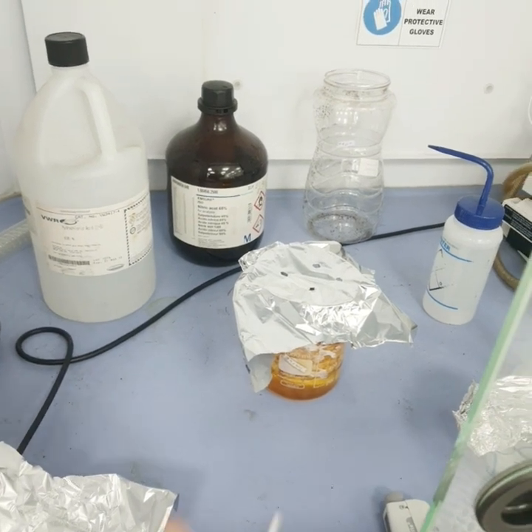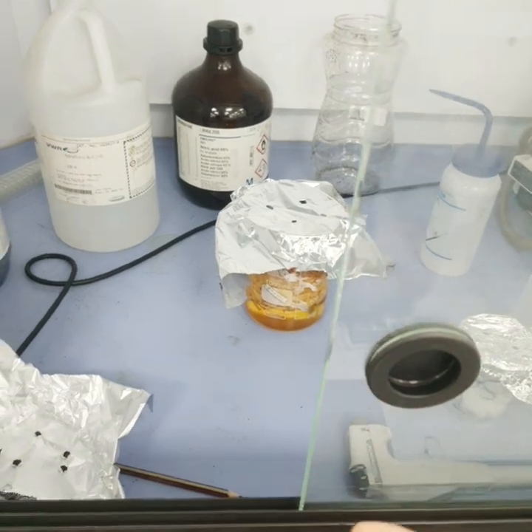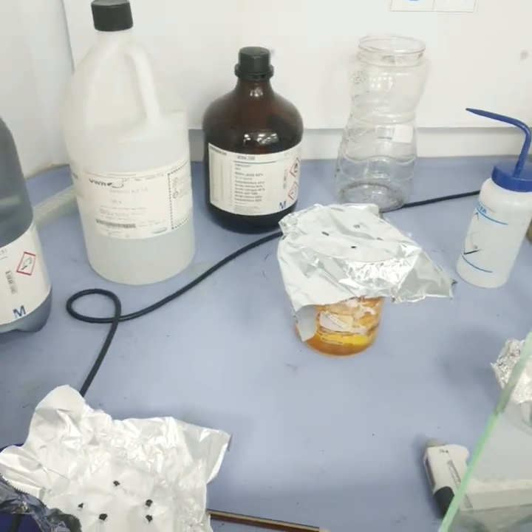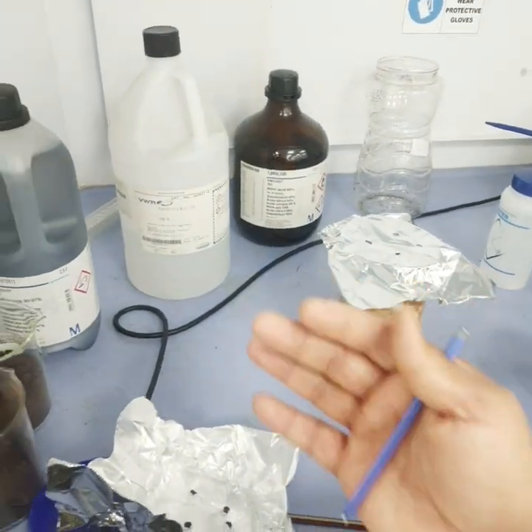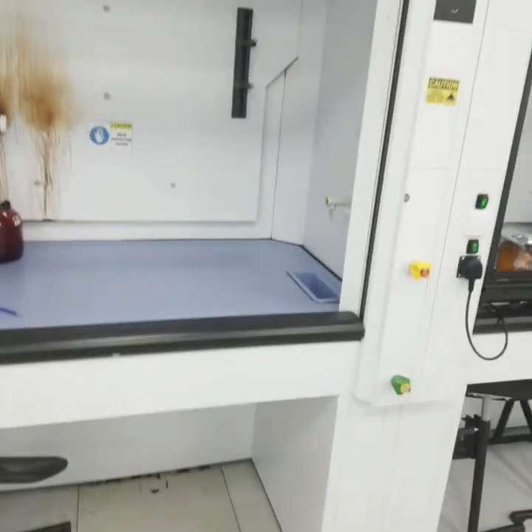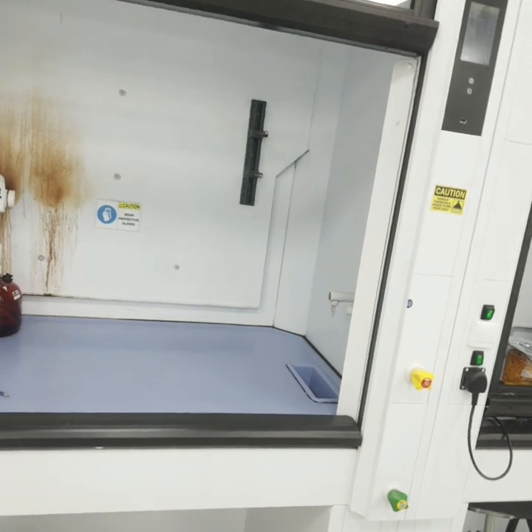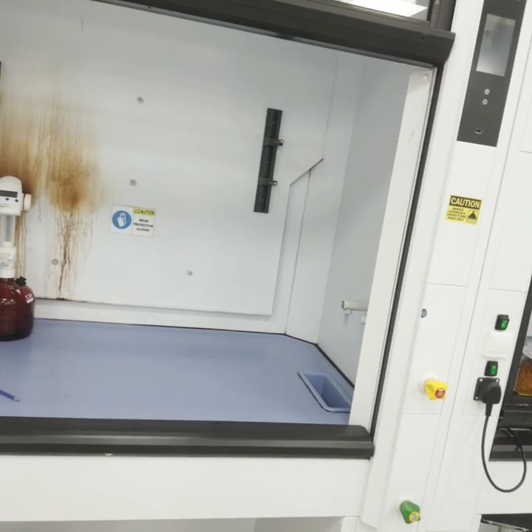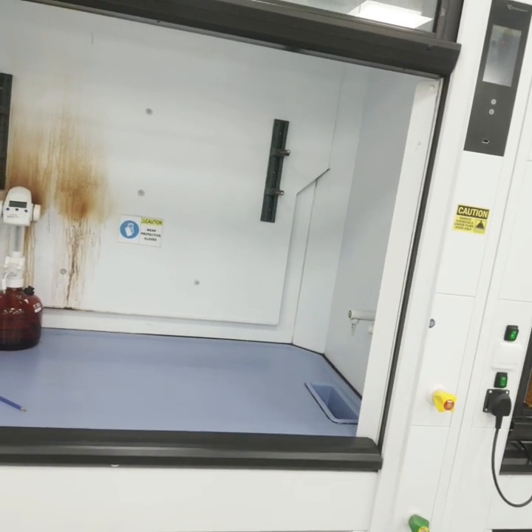The Safety Data Sheet — also called the Material Safety Data Sheet — is available with the chemicals when purchased, or can be found online. The fume hood will protect us from these harmful chemicals. You might also wonder: is the fume hood safe with flammable materials?